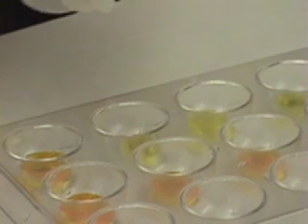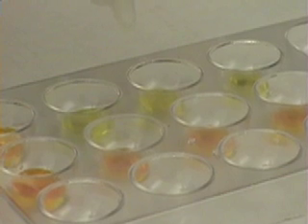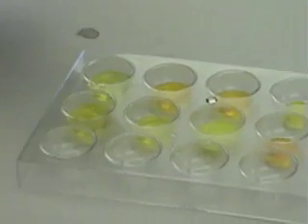In this portion of the lab, we added the sodium hydroxide to the potassium chromate and the potassium dichromate. The potassium chromate stayed yellow, while the potassium dichromate changed to yellow. This is because the hydroxide from the sodium hydroxide pushed the equilibrium equation to the side of chromate, which is yellow. When we added hydroxide to the solution which we originally added hydrogen to, it pushed the equation back towards the chromate side, making the solution yellow. When we add hydrogen to the side to which we originally added hydroxide, it pushes the equation back towards the dichromate — orange.